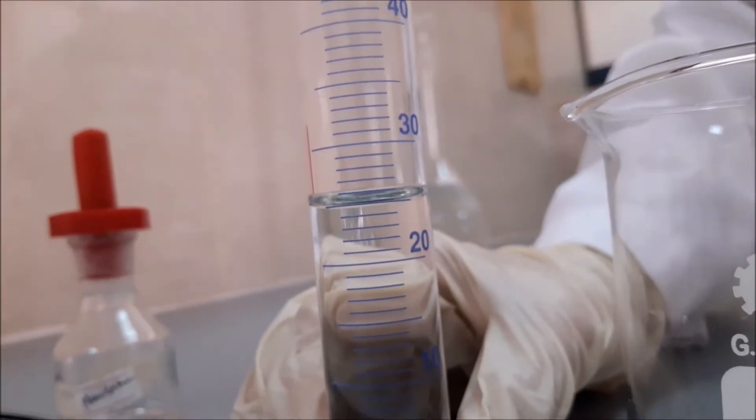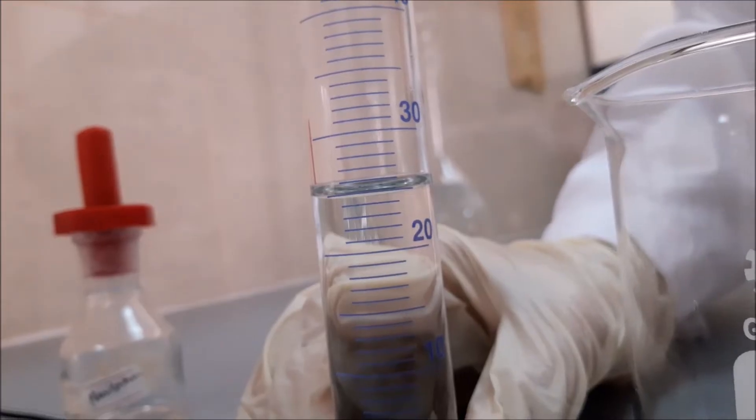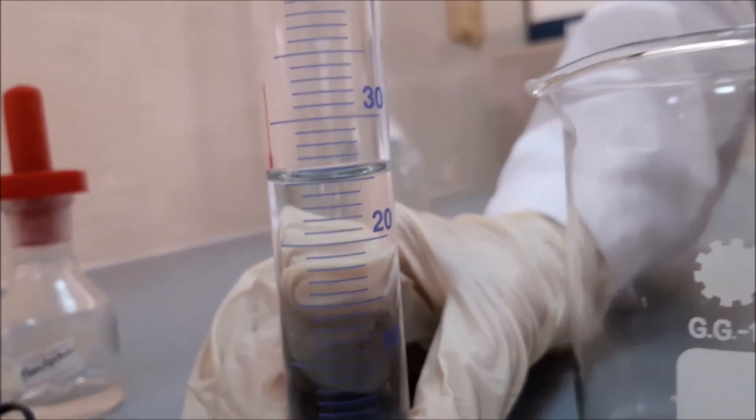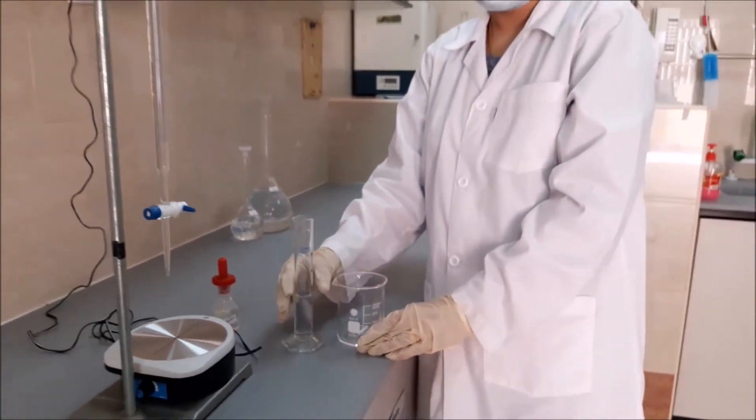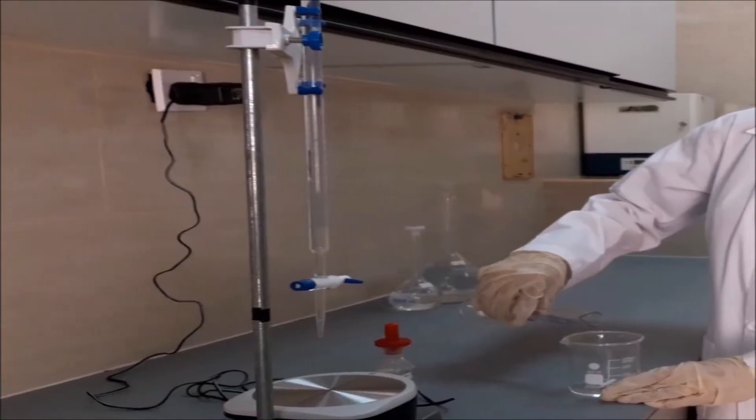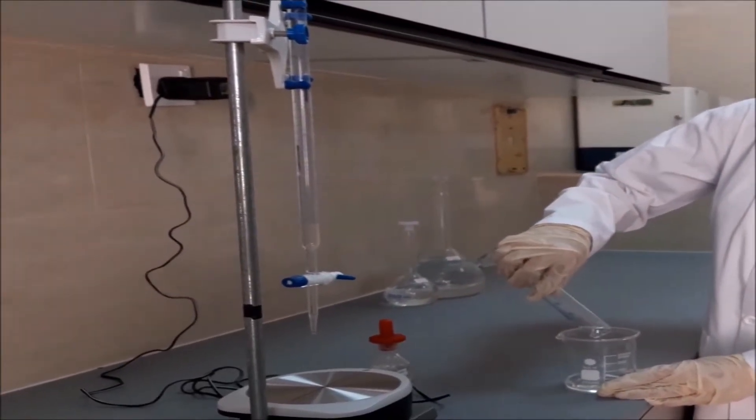And I have here 25 ml of sodium hydroxide. So I'll pour this in the beaker and later I will drop a few drops of phenolphthalein.